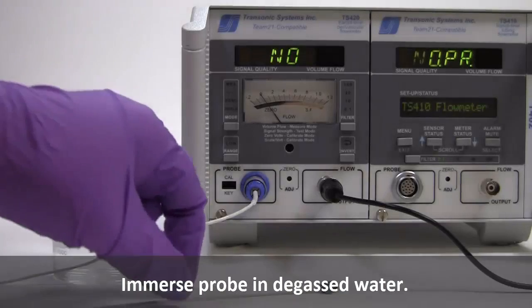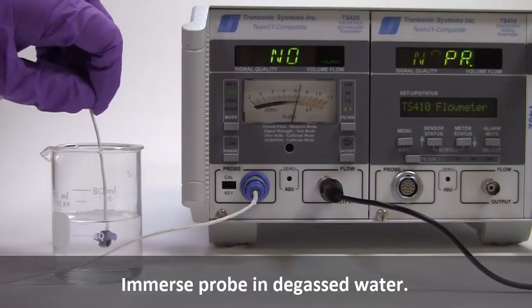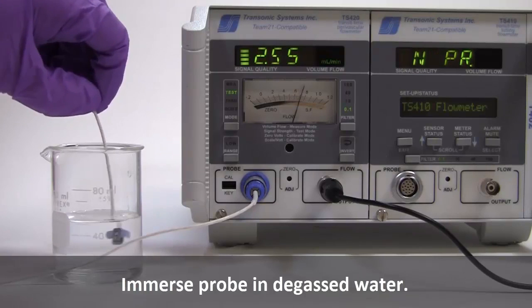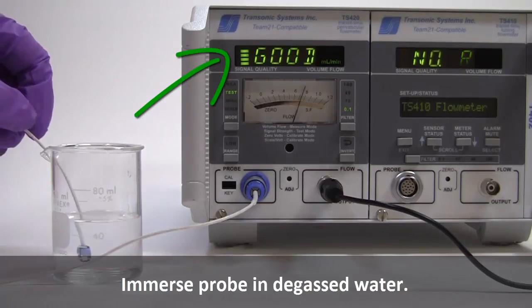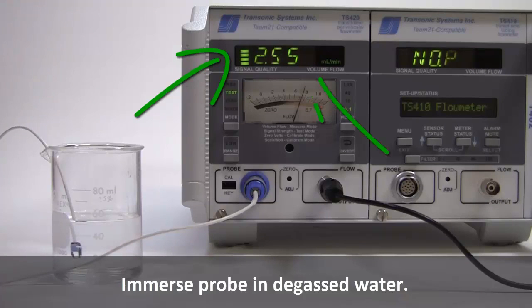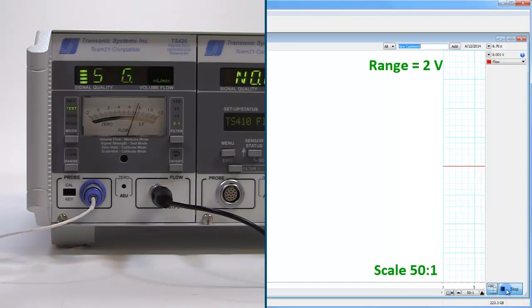Next, immerse the probe in degassed water, dislodge any air bubbles from the surface of the probe, and observe the front panel indicators on the flow module in test mode. In the top left corner, the bars of the signal quality indicator should be fully illuminated and the digital display will read good signal. In LabChart, I've set the range at 2 volts and the scale at 50:1.